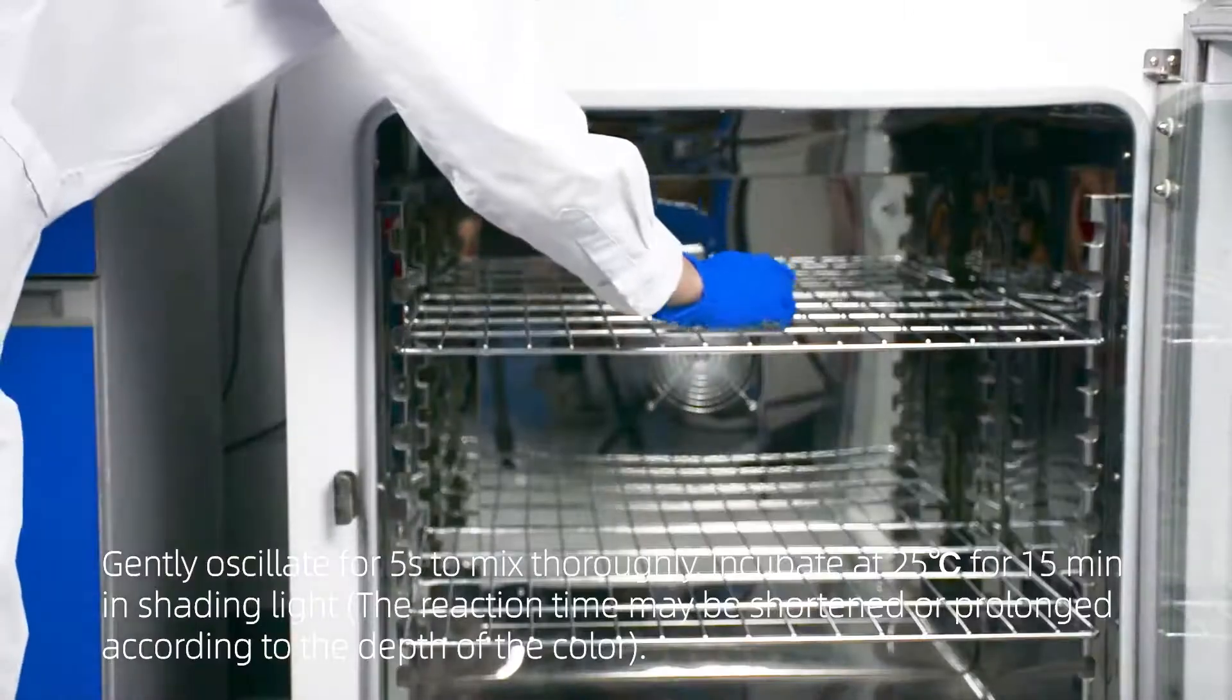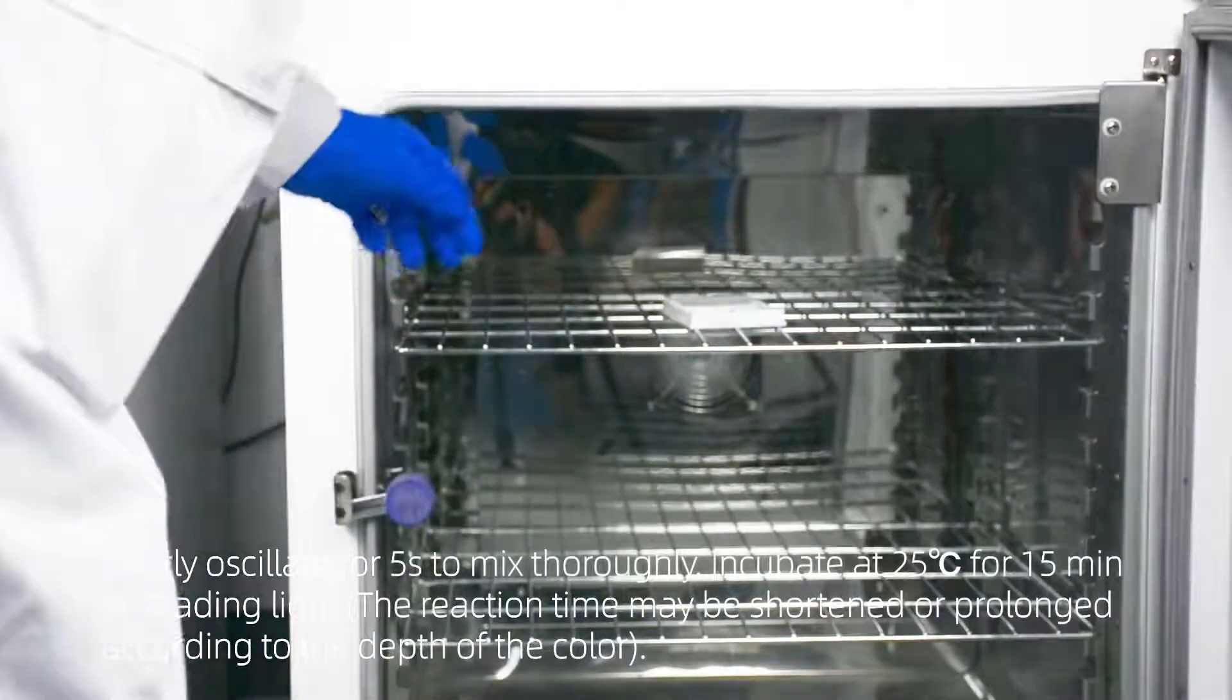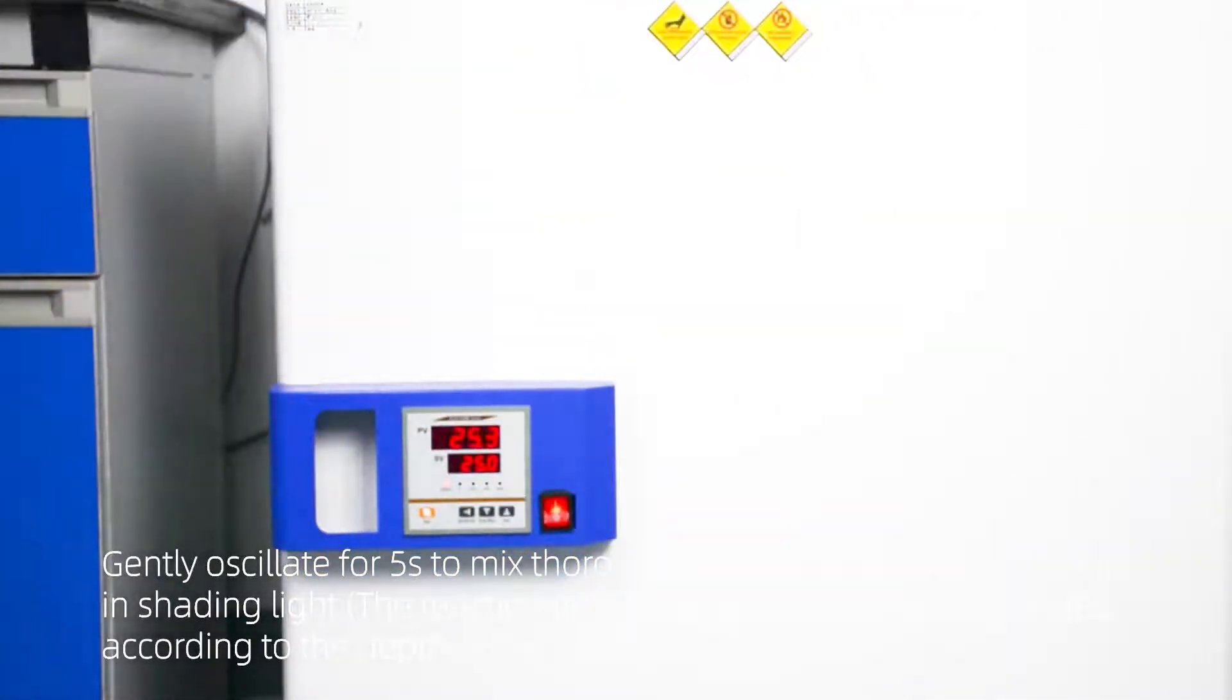Incubate at 25°C for 15 minutes in shading light. The reaction time may be shortened or prolonged according to the depth of the color.